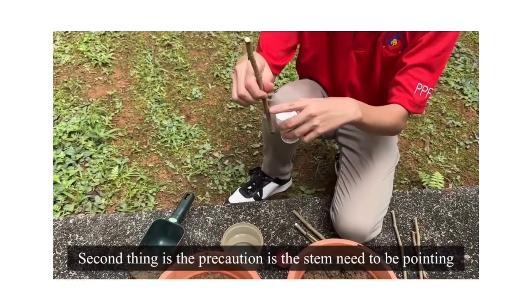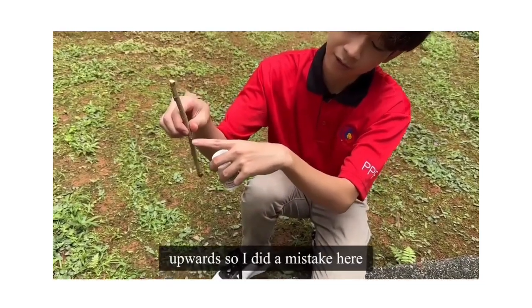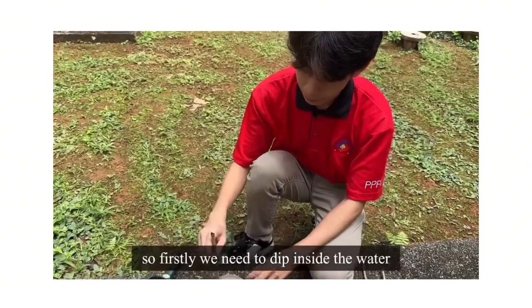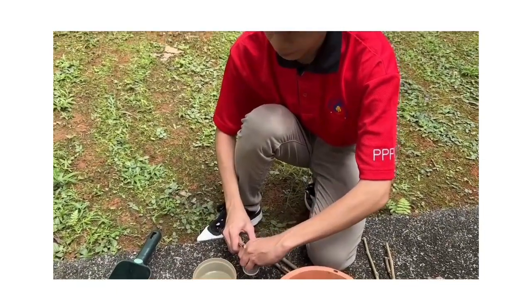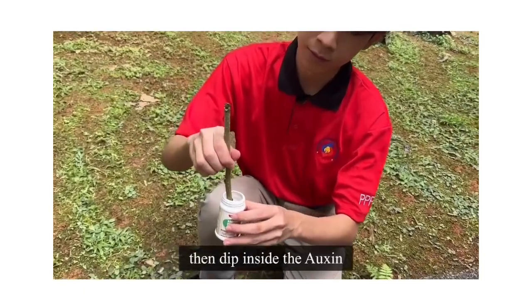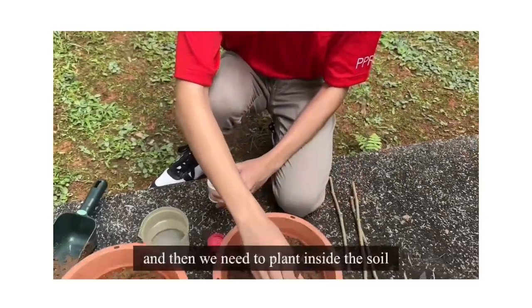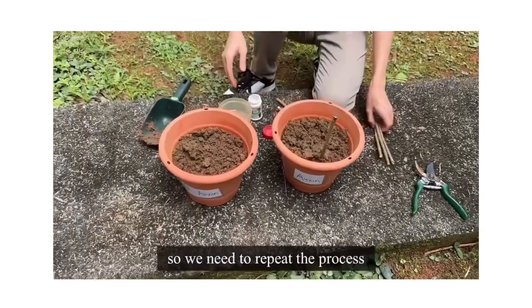The second precaution is that the stem needs to be pointing upwards. So I made a mistake here. This one is pointing downwards. So it's actually supposed to be like this. So we need to dip inside the water, and inside the auxin. And we need to tap off the excess, like so. And then put it inside the soil. So I need to repeat the same process.